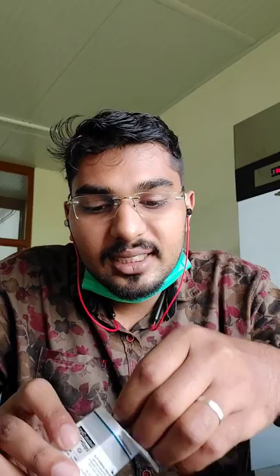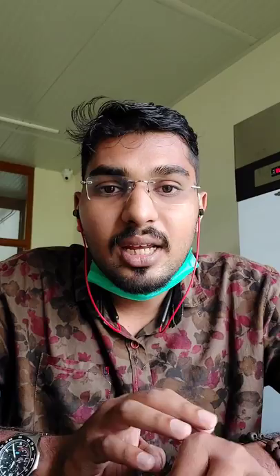We also use a standard antibiotic disc as a control. These antibiotic discs are coated with certain antibiotics - for example, this disc is coated with ampicillin and cloxacillin. This acts as the positive control - a standard drug - so we can compare whether our plant extract has higher or lower antimicrobial activity than the standard antibiotic disc.